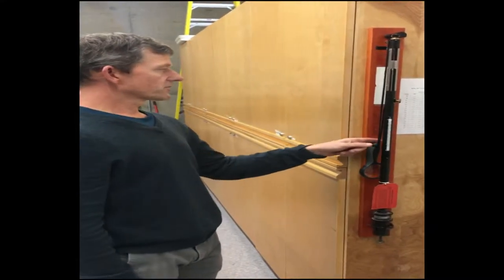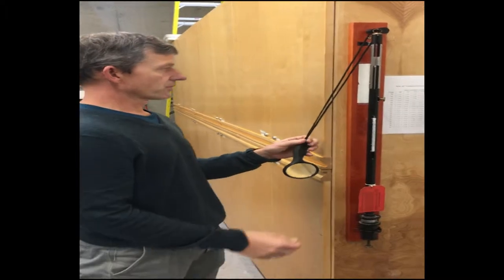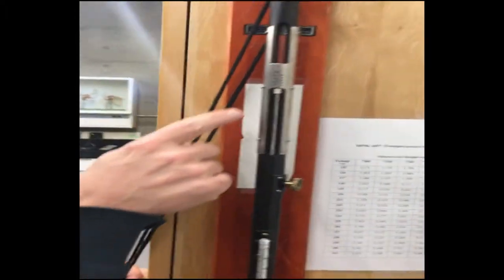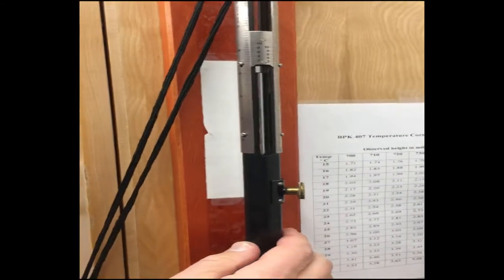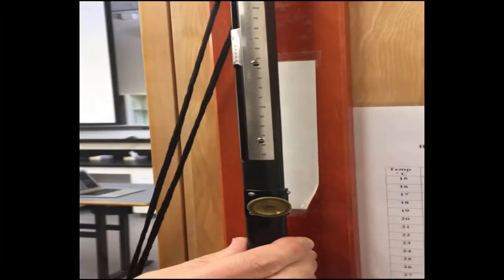We are going to measure barometric pressure, and this is the barometer that we use in the lab. The first thing you need to notice is there are two scales. This scale is in inches of mercury - we don't want to use that. We want to use millimeters of mercury. For our purposes, we'll always be using millimeters of mercury.